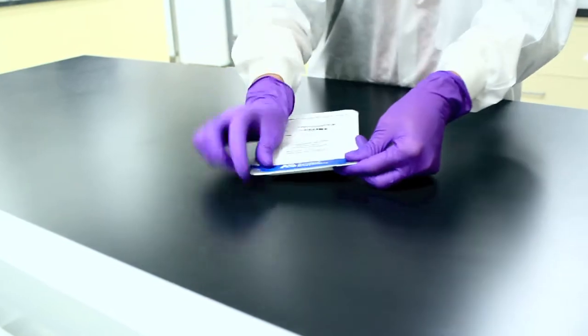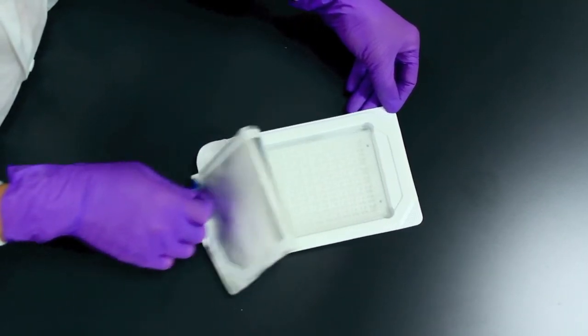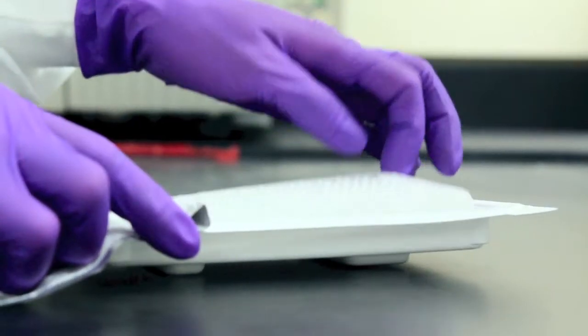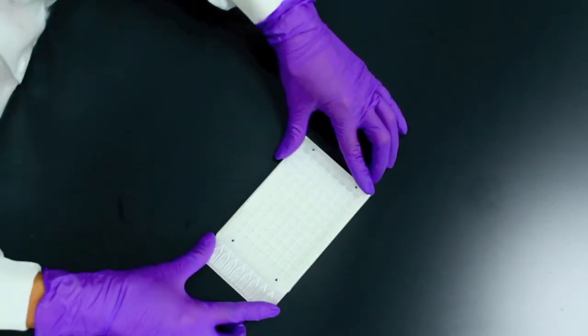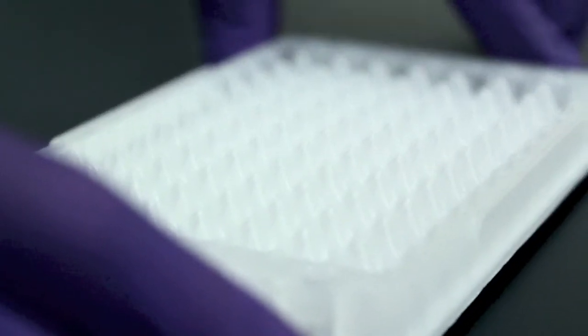It's never been easier to customize TaqMan microRNA cards with over 3,200 pre-designed microRNA assays and the custom array design tool from Life Technologies.